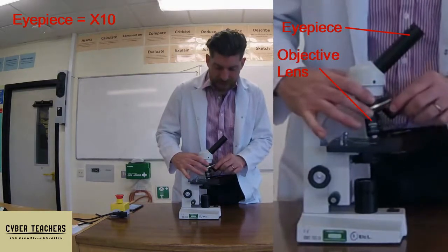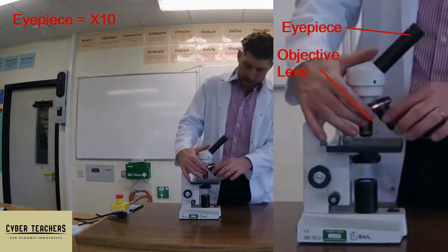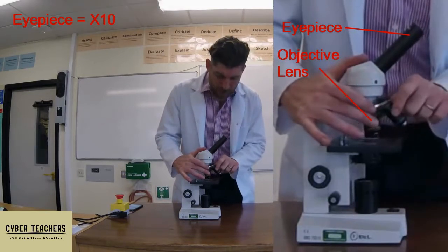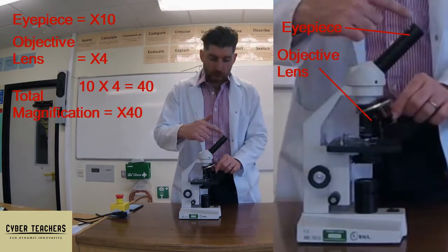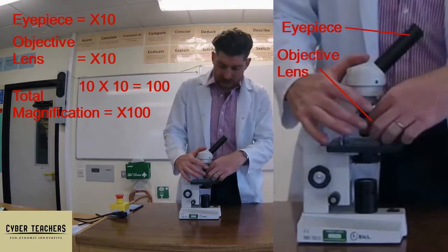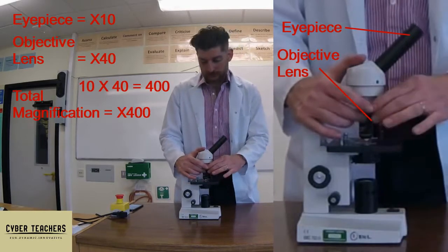Looking down the eyepiece, your sight line goes down through the objective lenses. As you can see, they rotate — we've got three of them. The smallest one has the lowest magnification, the medium one has a medium magnification, and the longest one has the highest. The lowest magnification is ×4, the middle is ×10, and the strongest is ×40. Combined with the eyepiece: 10×4 = 40, 10×10 = 100, and 10×40 = 400 times magnification.